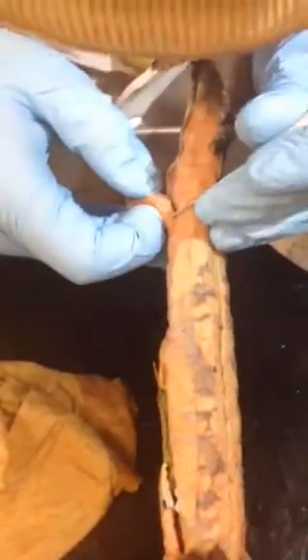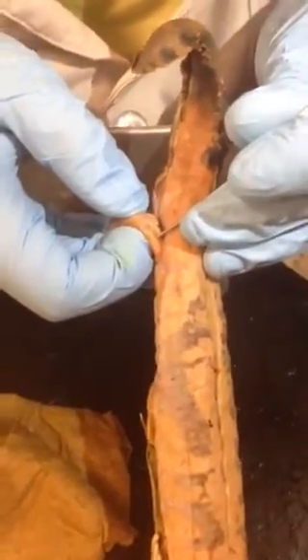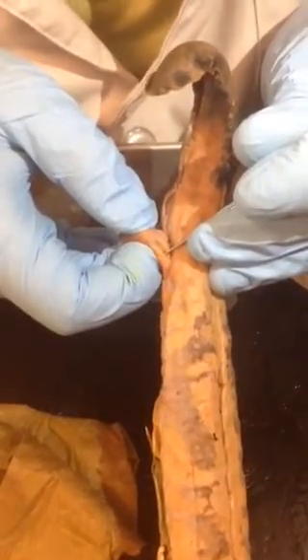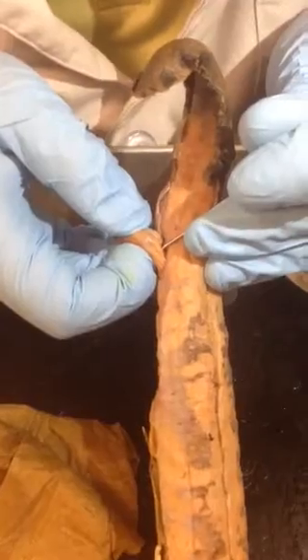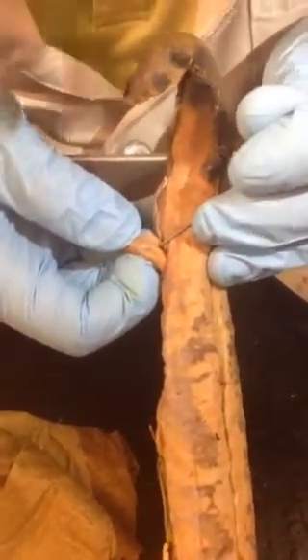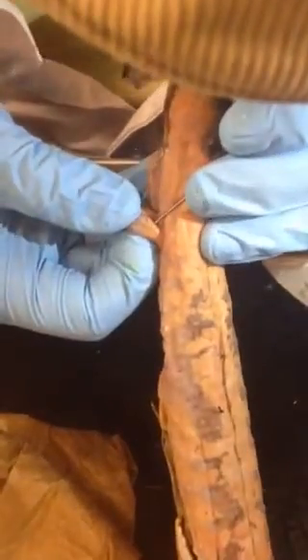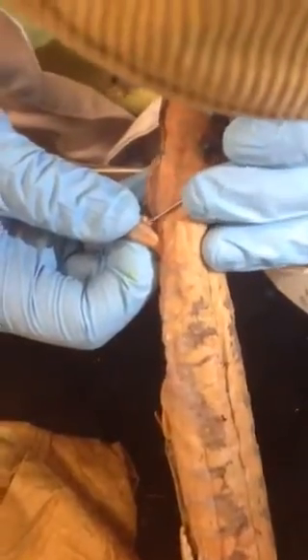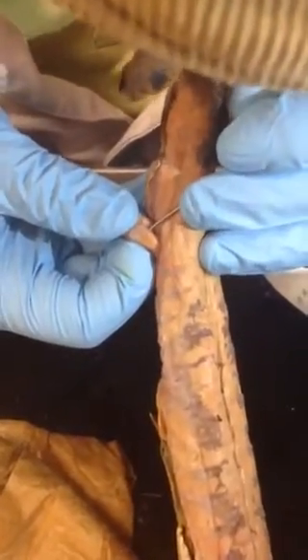Okay. So this one right here is from the other side. This one right here is iliotibialis, followed by the big one in the center, which is ilioextensorius, followed by this one. It's on the side. Got a little fascia on it, unfortunately. There it is. Right there.